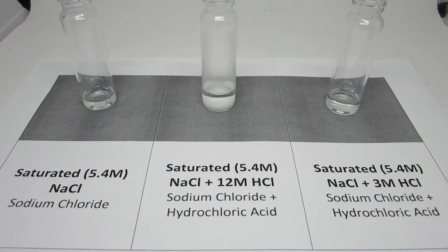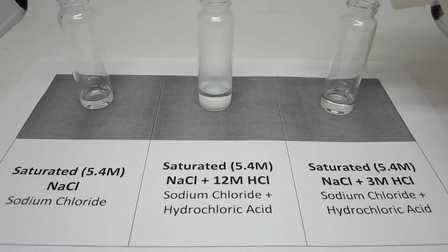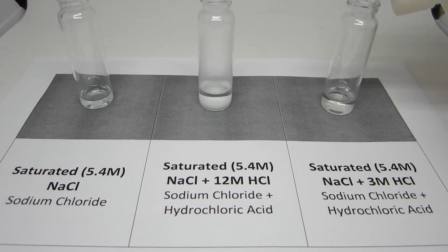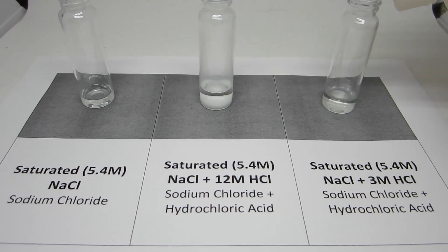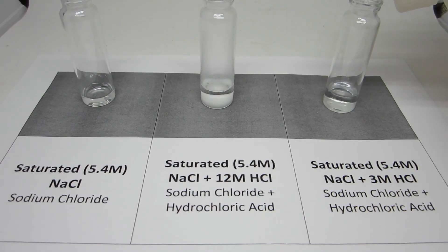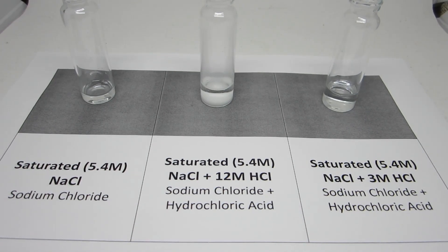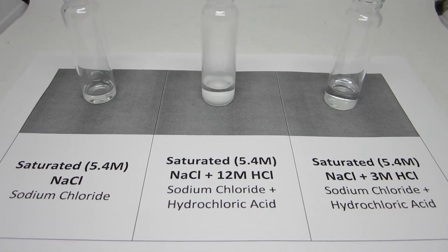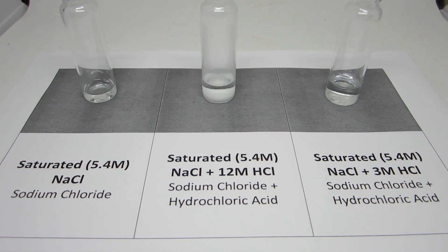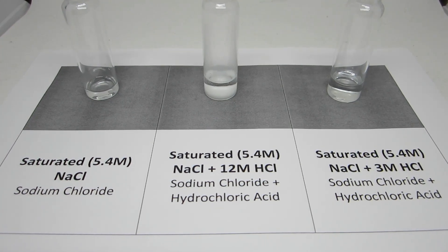When hydrochloric acid is added at a lower concentration of 3 molar, which is below the solubility of sodium chloride, there is no visible change in the reaction. Overall, the concentration of chloride ions has decreased to below 5.4 molar but above 3 molar.